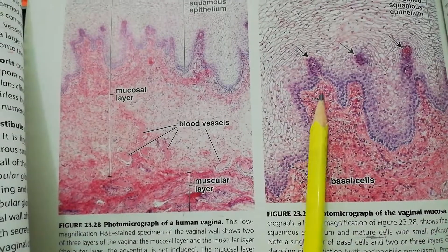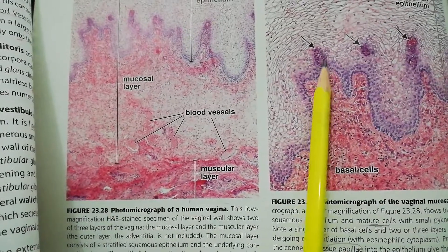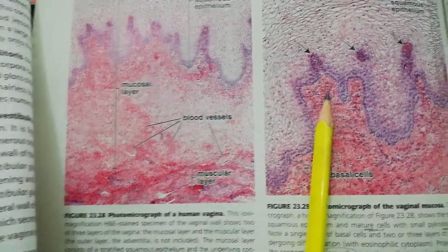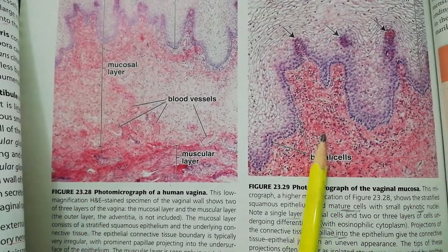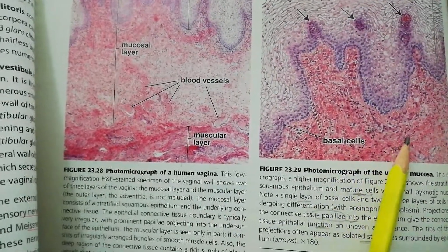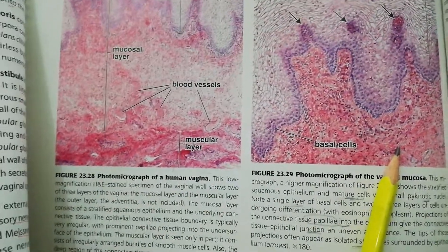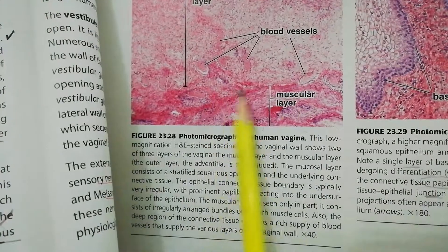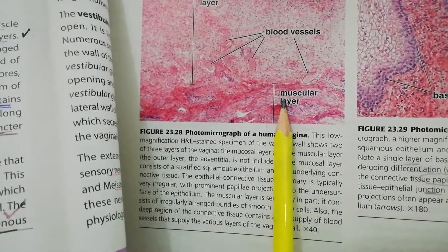Next to the epithelium is the lamina propria, which sends papillary projections inward — as you have already learned when studying stratified squamous epithelium. The lamina propria is made up of loose connective tissue well laden with elastic fibers. The cells present include neutrophils, a large number of lymphocytes, and a neurovascular bundle.